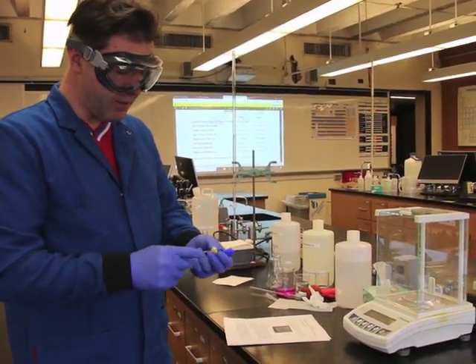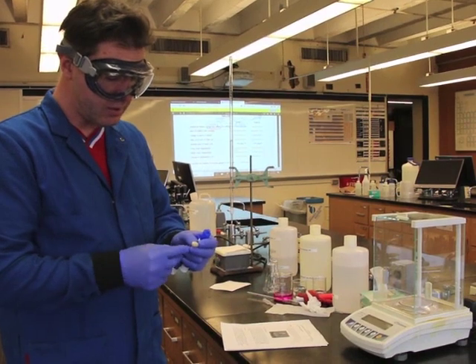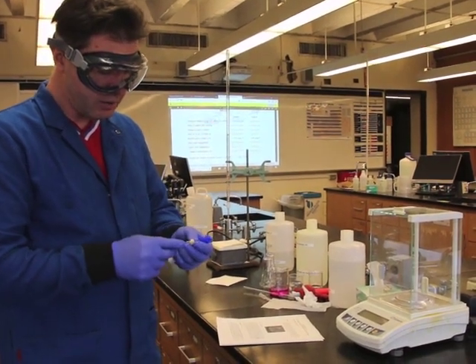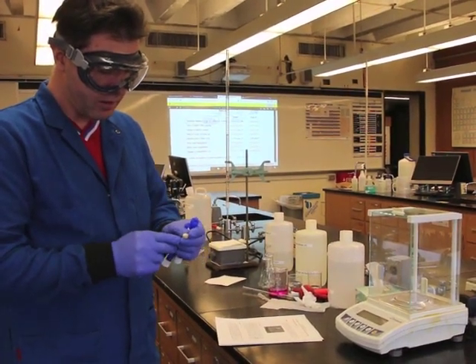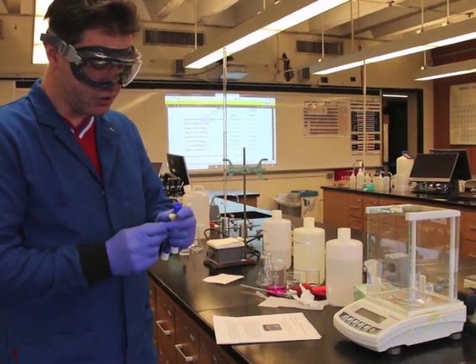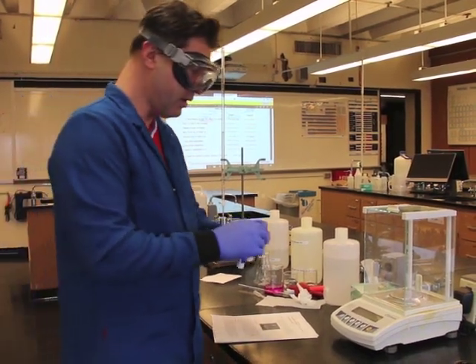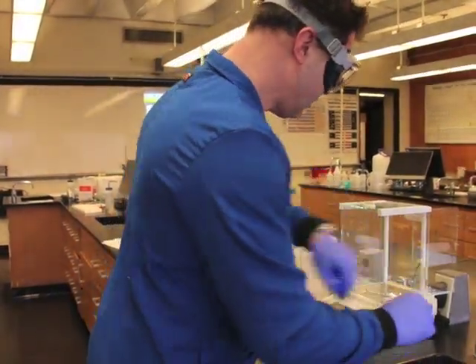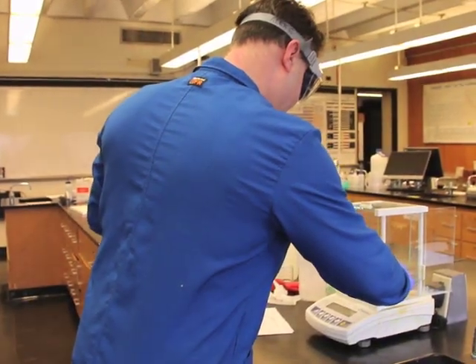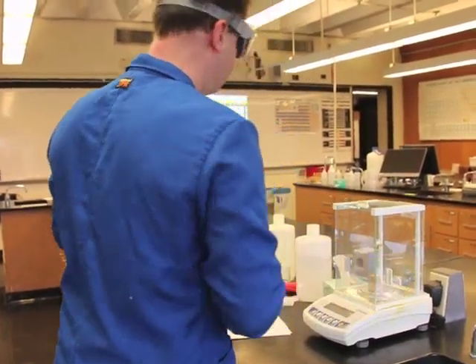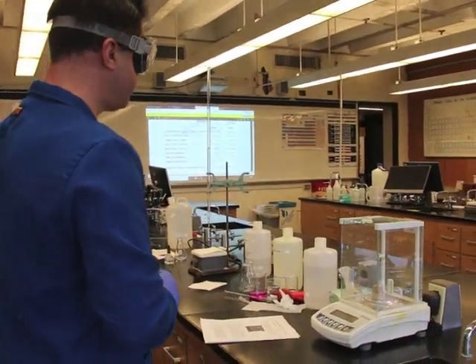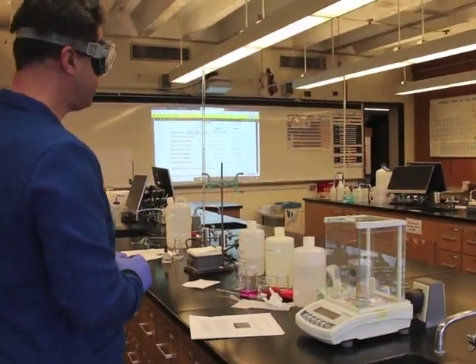Now the next step is I have to measure the mass of my cashew itself. I'm going to position it now on this assembly and take the mass of the cashew plus assembly. My mass now is 6.4792.